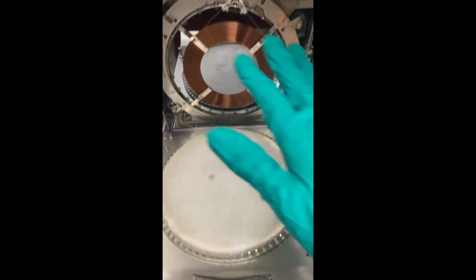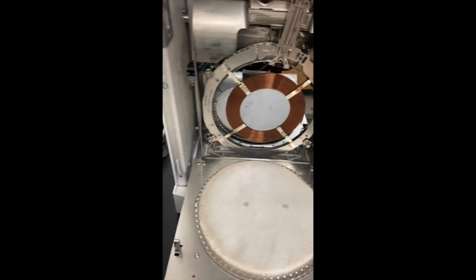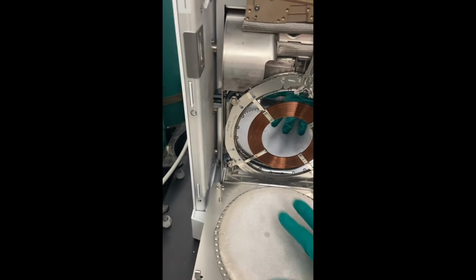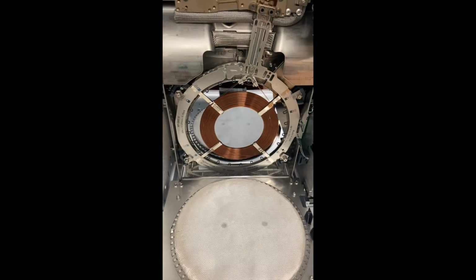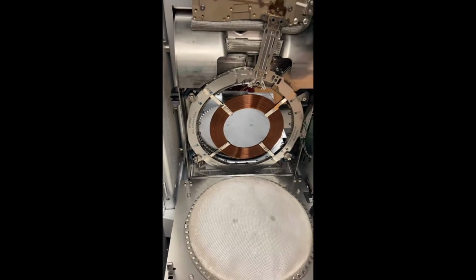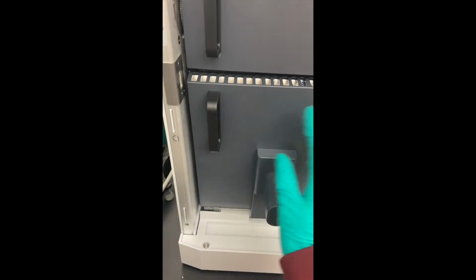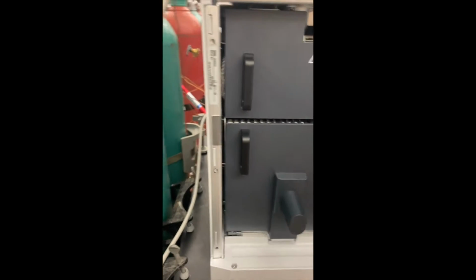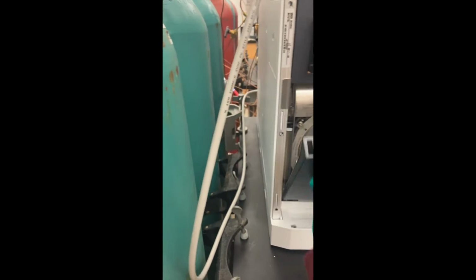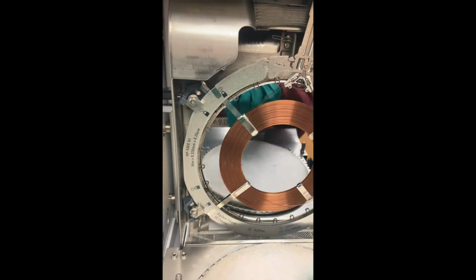As you can see, it looks quite different than the conventional GC-MS oven. This has a direct heating panel, which allows for very efficient and fast methods. It heats up faster and it cools down faster. So the reproducibility on this instrument is actually very, very good. It doesn't change much even month to month. So that's nice. That's all you guys need to see from that. Oh, but just make sure you get the name of the column. Remember, we always want to note the name of our column.